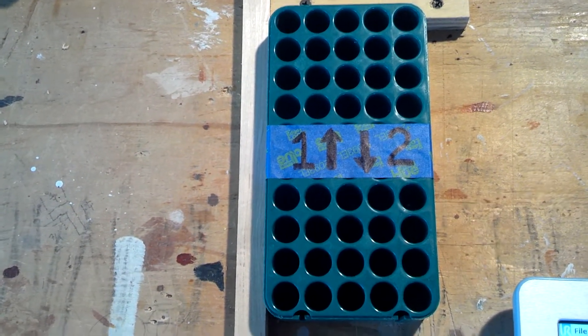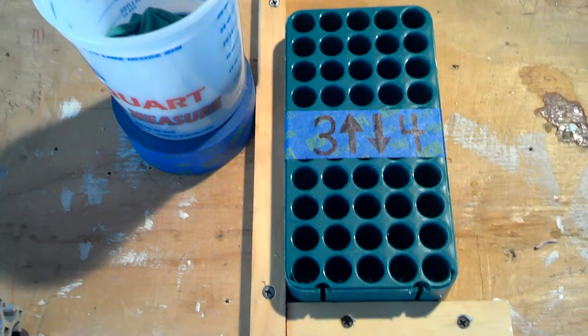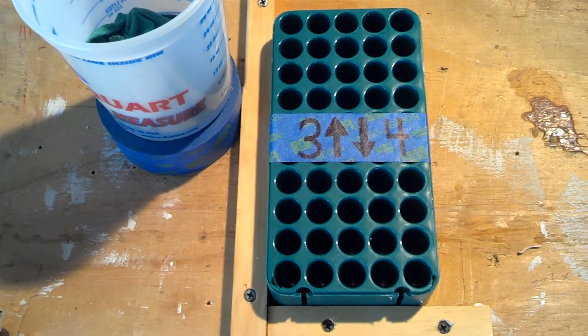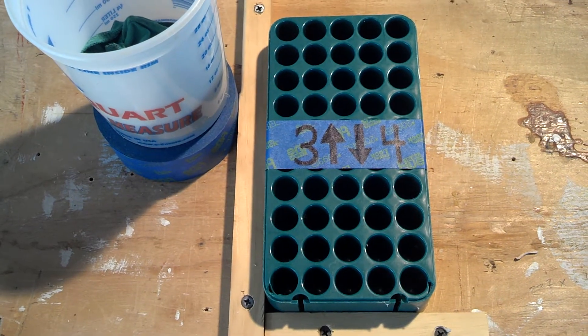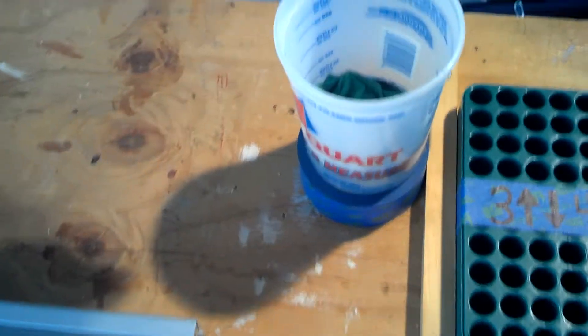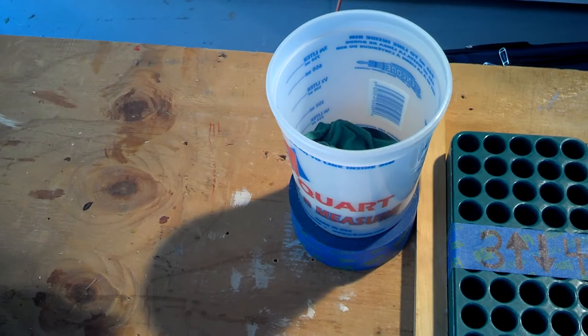So you've got tray one at the top, tray two at the bottom, tray three or pallet three and pallet four at the bottom, three at the top, and then a reject or a generic dropbox.